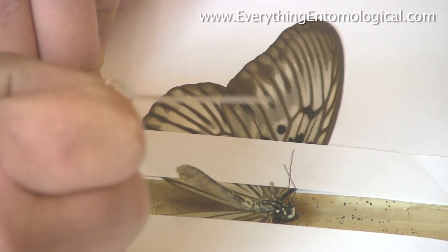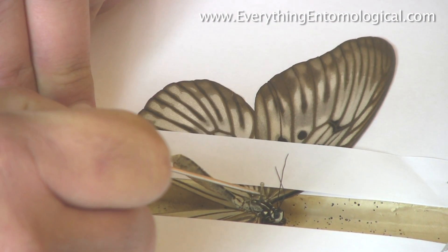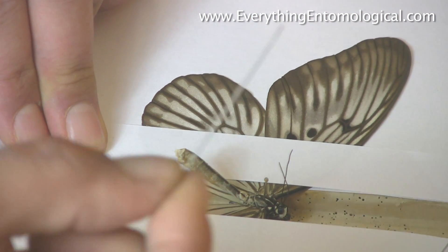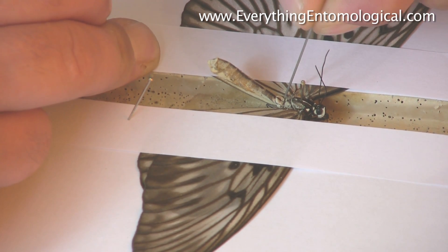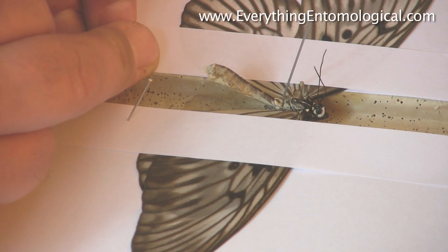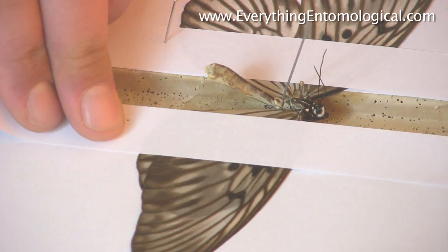Another way: get the pin and go for the veins right near the thorax and do this — I'm lifting. If the body is twisting, you overcome that by using a large pin. When the body's twisting, put a large pin here and just push there so the thorax starts to come level. When it's level, carry on. Or if you think you want it higher, that's totally your own choice.